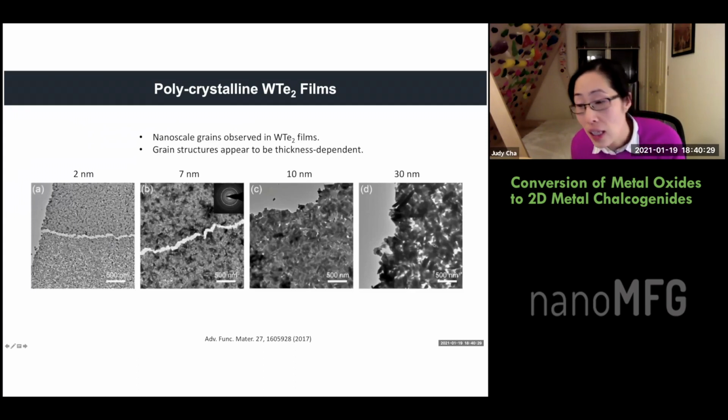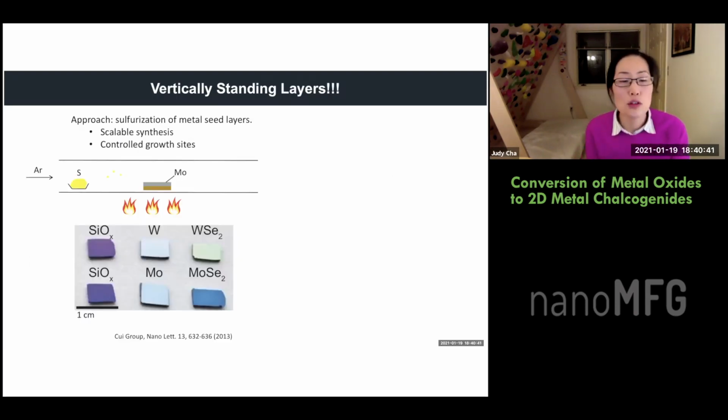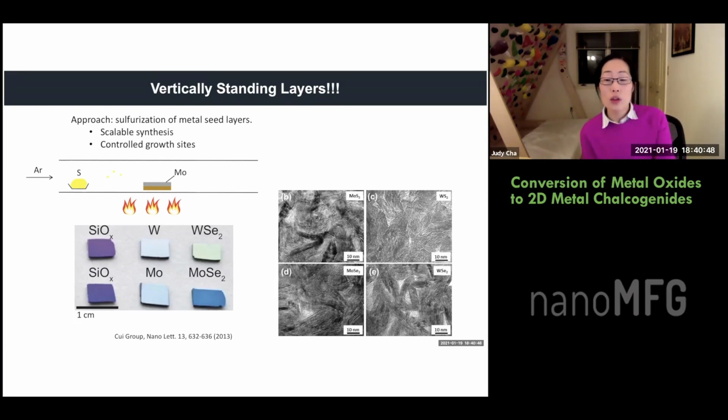And the other thing is that for thicker films, the layers are not lying flat, but they start standing upwards. And this we knew from the beginning. So here, when we are sulfurizing or selenizing the metallic film, and then when you look at it from TEM, what you see is that the molecular layers are standing vertically, not lying flat. So here's a 3-dimensional representation of the film. So again, this is not so good, right? If you want to do transport, because you're doing a lot of hopping of electrons through the van der Waals layers.